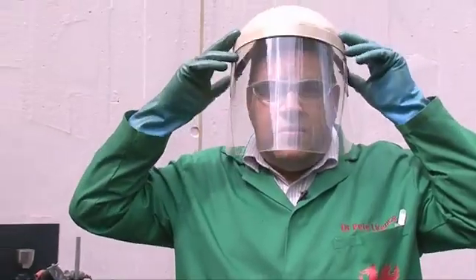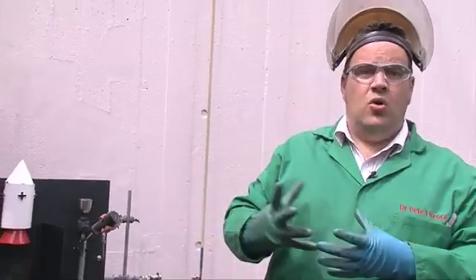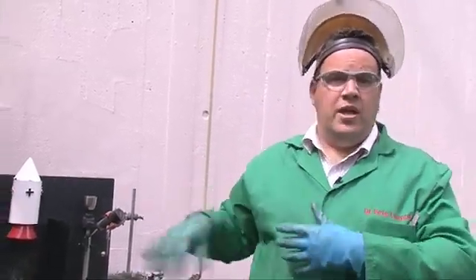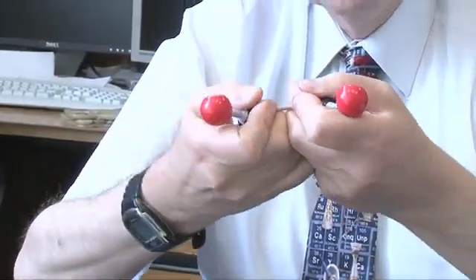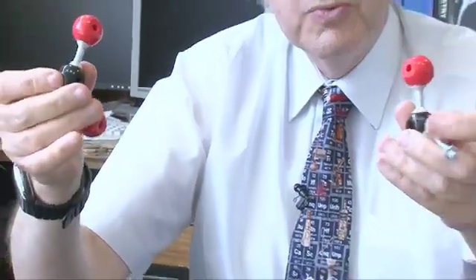First we're going to put in the oxidant. This is the N2O4 and the N2O4 is a gas and we're going to condense it into a cold or a pre-cooled vessel before pouring it into our fuel tank. When it vaporizes, it falls apart into two pieces, NO2, which are dark brown gas.